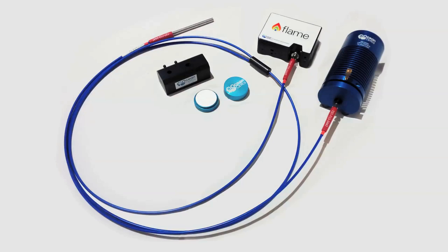In this video we will demonstrate how OceanOptics products can be used to perform a basic reflection measurement. We'll be using products available as a bundle for reflectance and also as separate products.